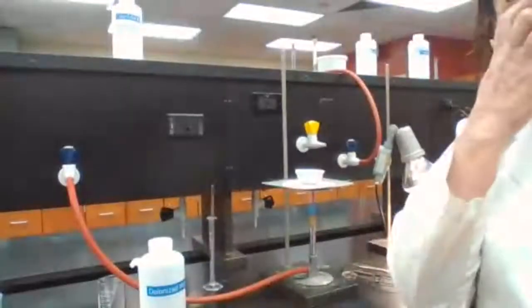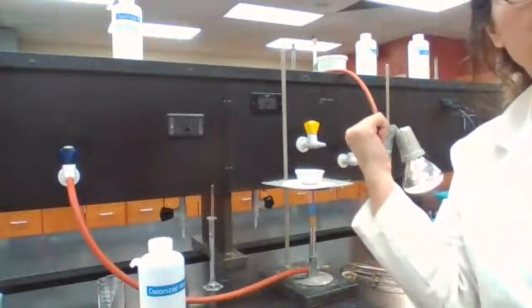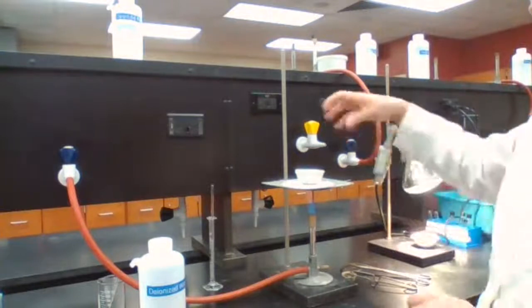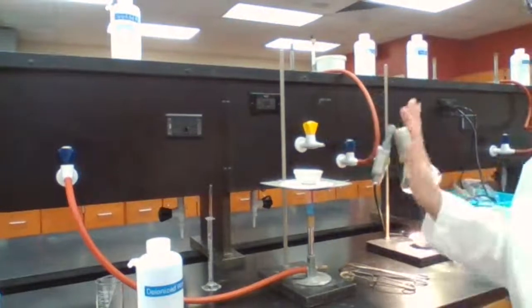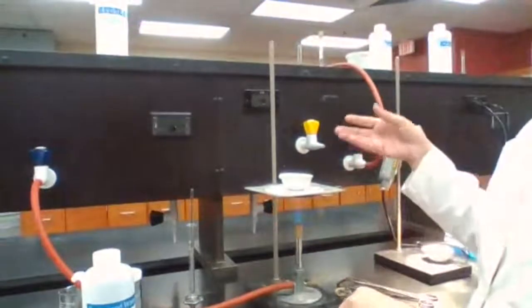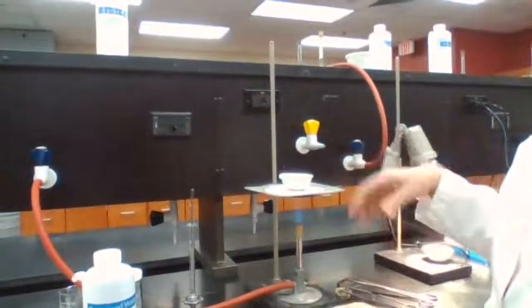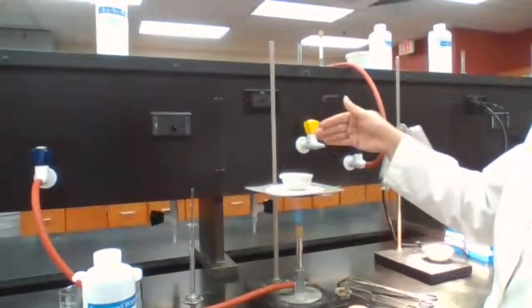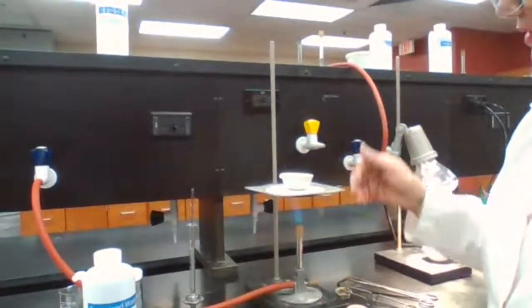So I monitor the boiling. Monitoring the boiling is going to show me if it's gentle boiling, and then I'm fine with it. If it's not gentle boiling, if it's boiling very harshly with big bubbles, there is a chance of spattering of the solution out of the container.